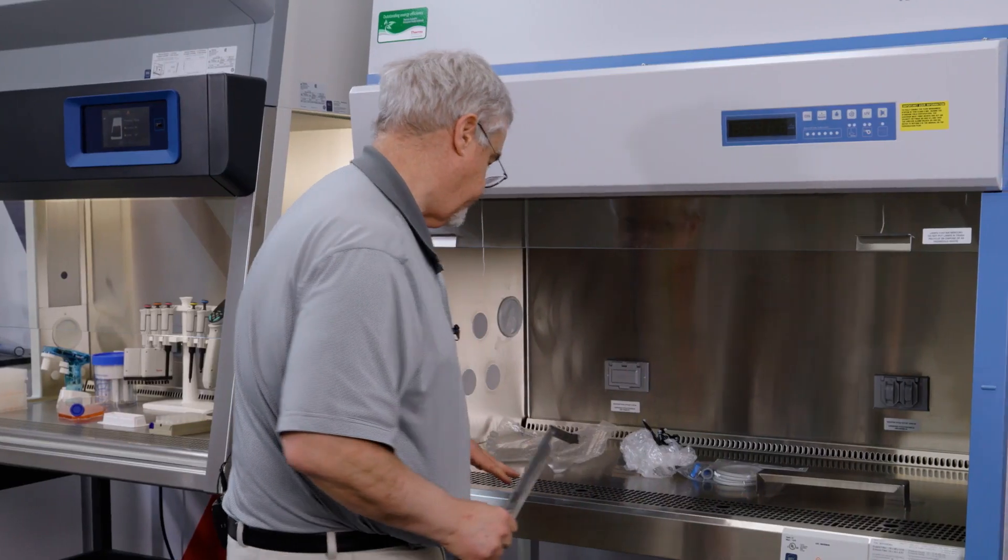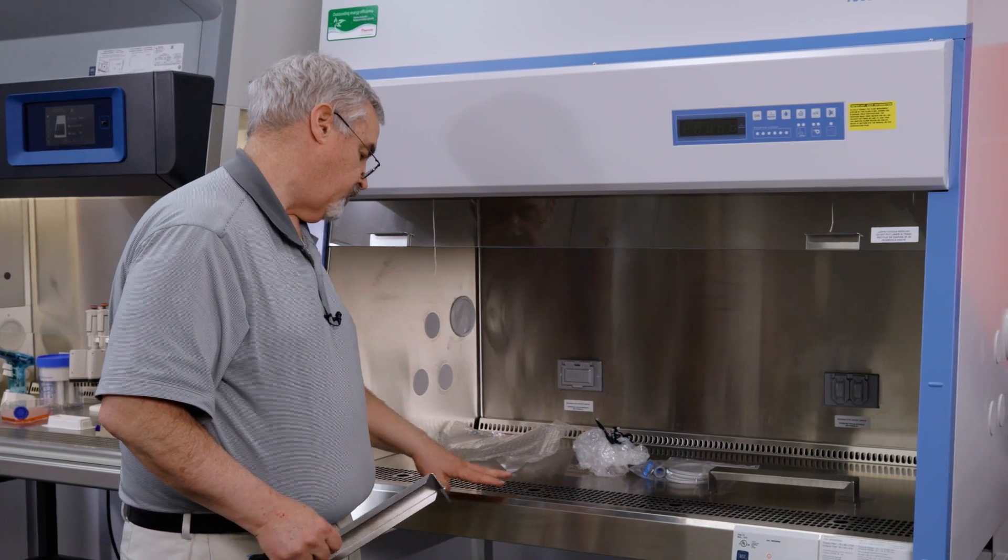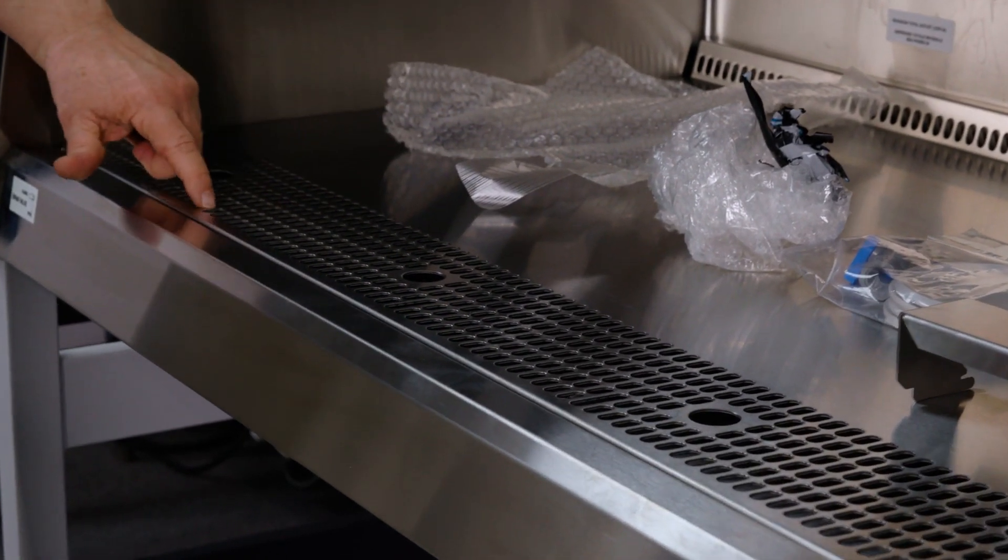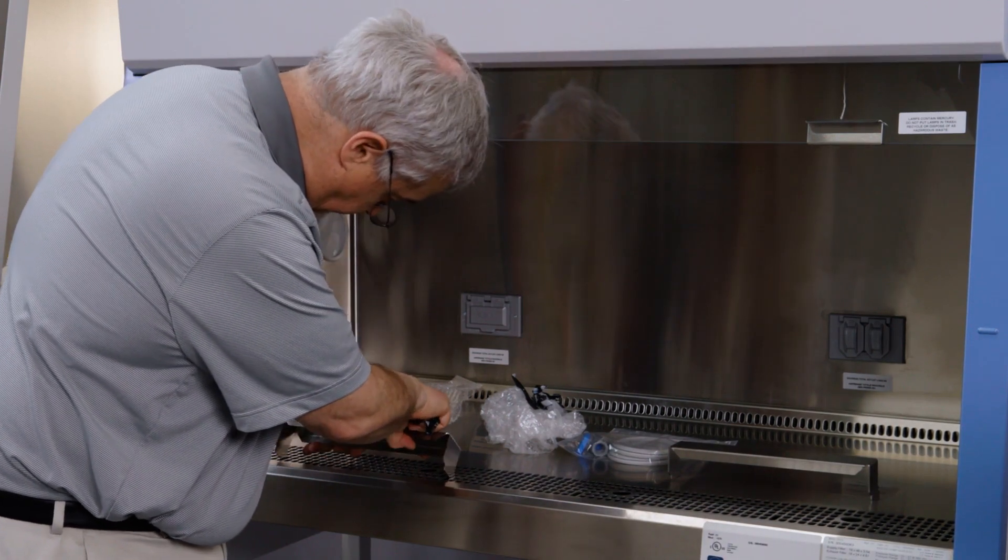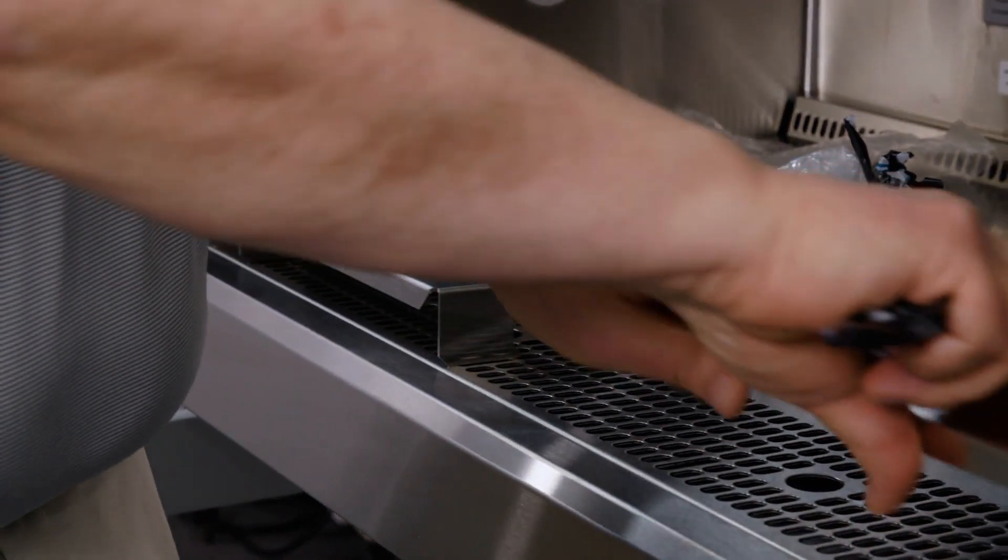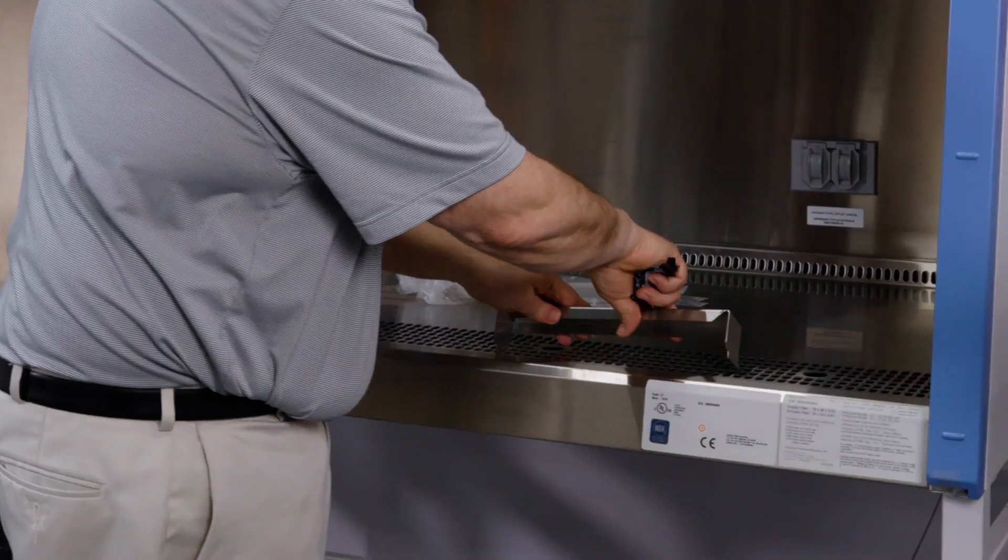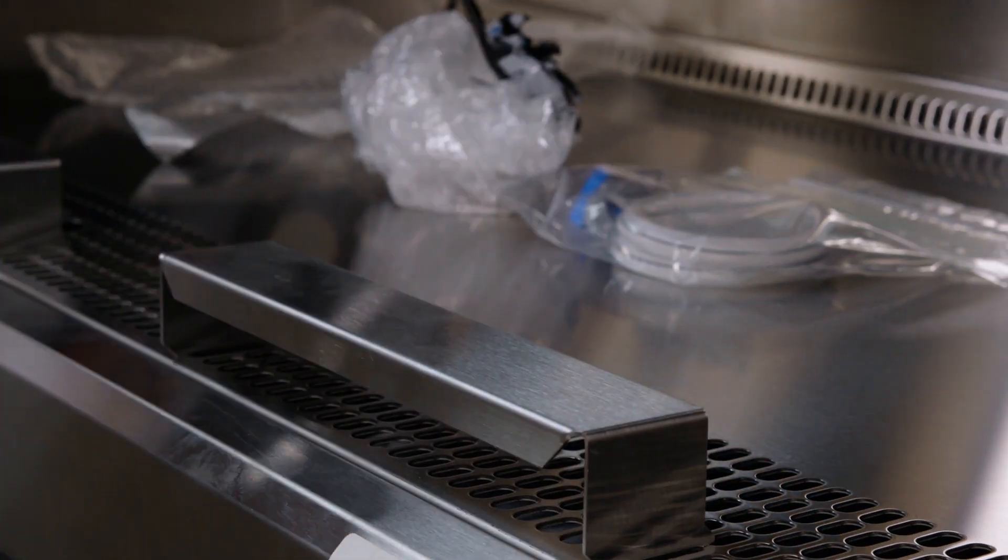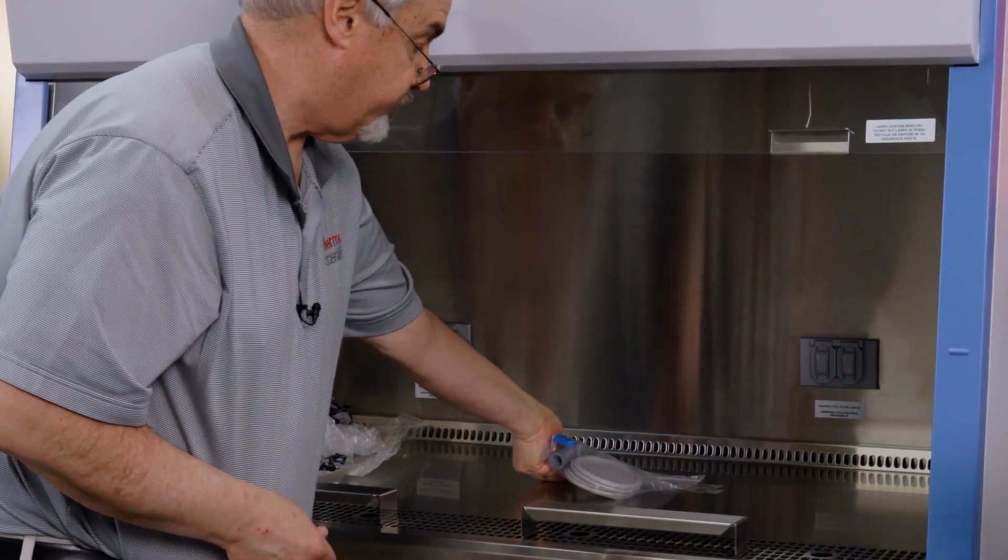The armrests fit into some defined locations. If you look closely on the work surface you'll see these larger slots. And now we're ready to put in the drain valve.